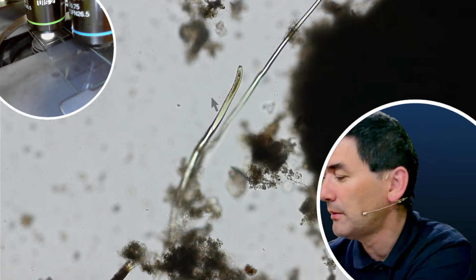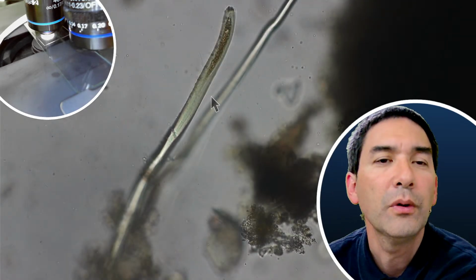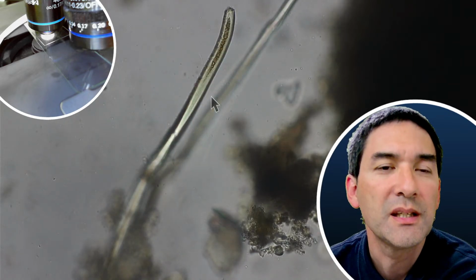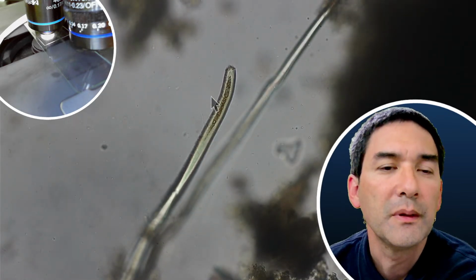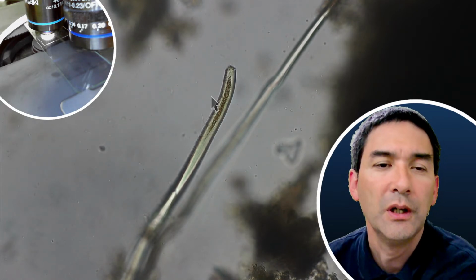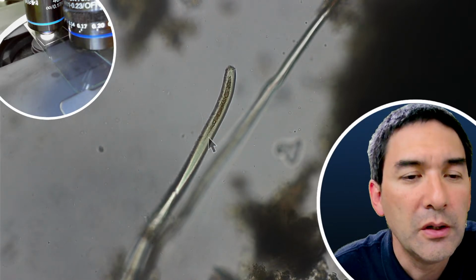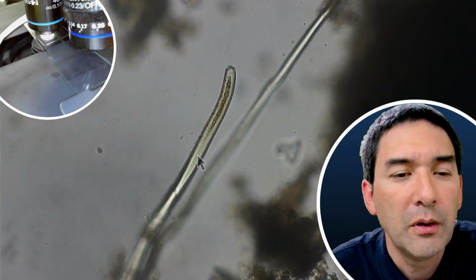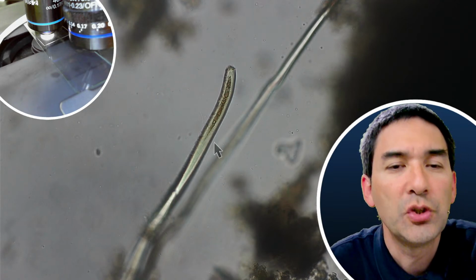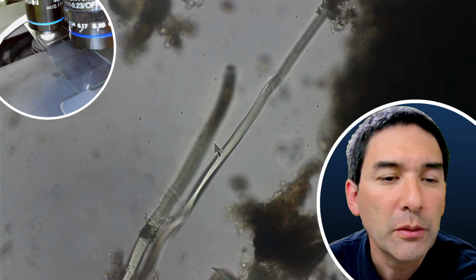Yeah, so here that might be a little bit interesting again, like I've seen before, where I'm suspecting that this could be some fur. The reason why I suppose that, and I'm not able to see it quite well here, is because of the surface texture, and also sometimes I was able to see a central canal, which is typical of fur and of hair. But again, I'm not entirely sure.